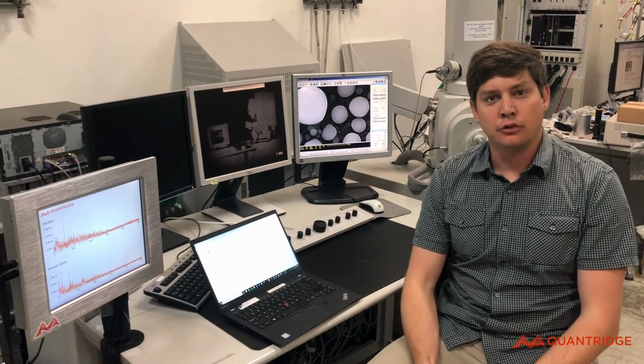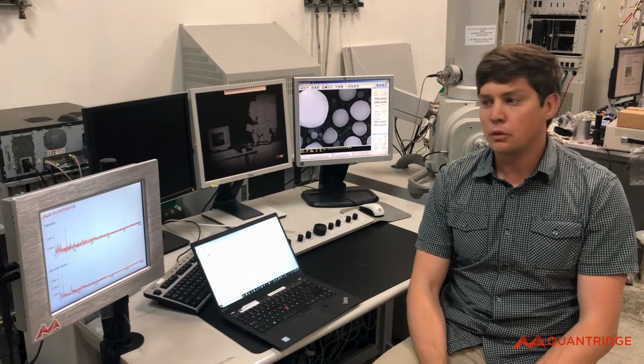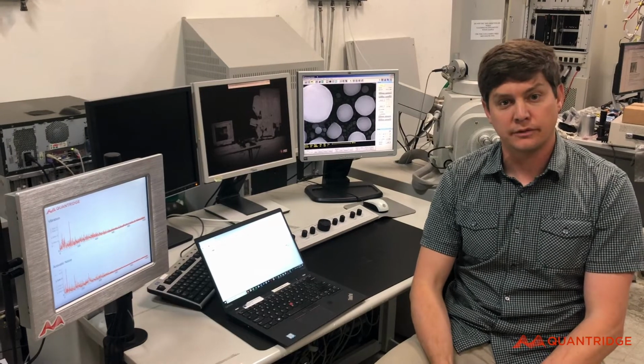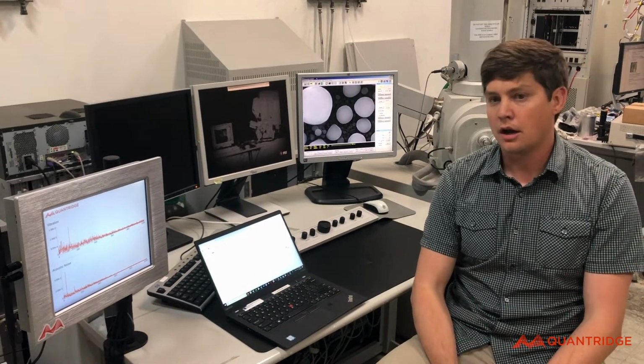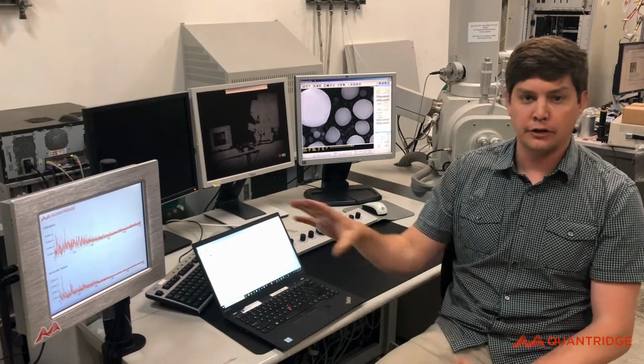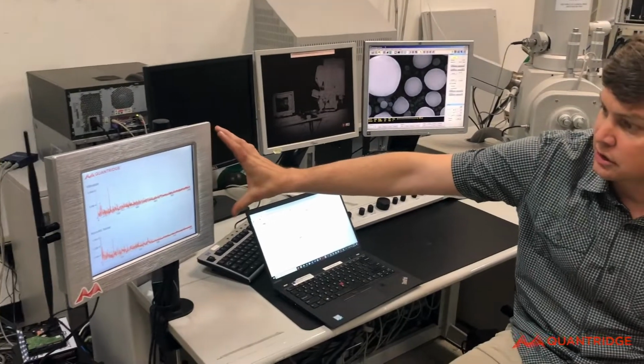We're here in Southern California doing some testing and doing some work with a customer, and we thought it'd be a good opportunity to show you how the Quantridge system works, show the responsiveness between the different displays, and give you a real-time demonstration for how the infrastructure works and how the different devices communicate with each other. So what I have here is a Quantridge system.